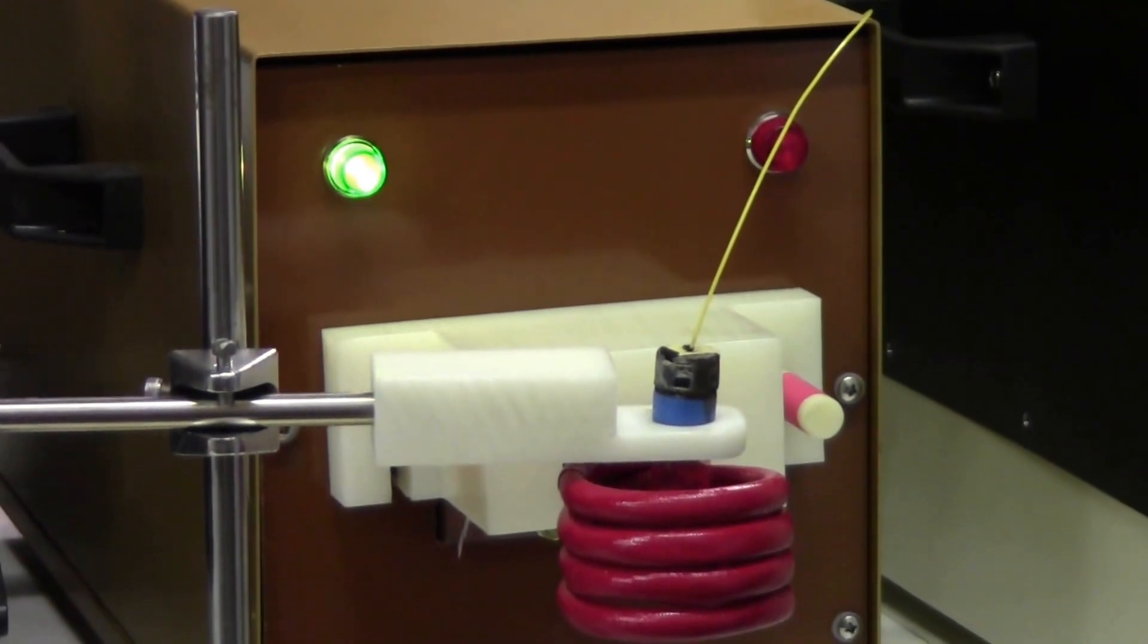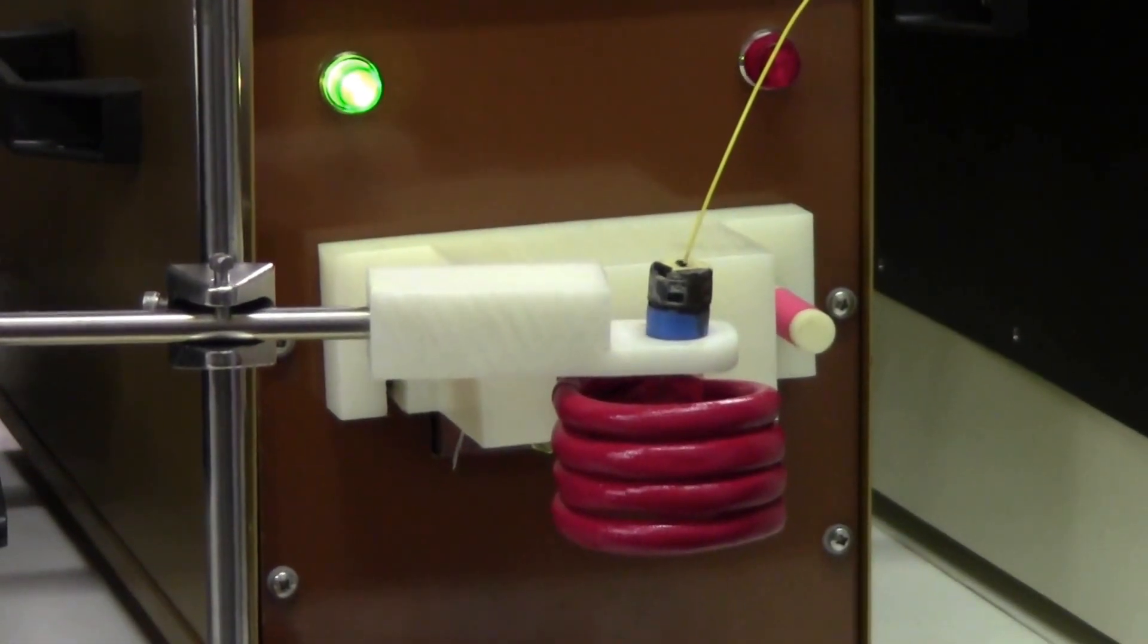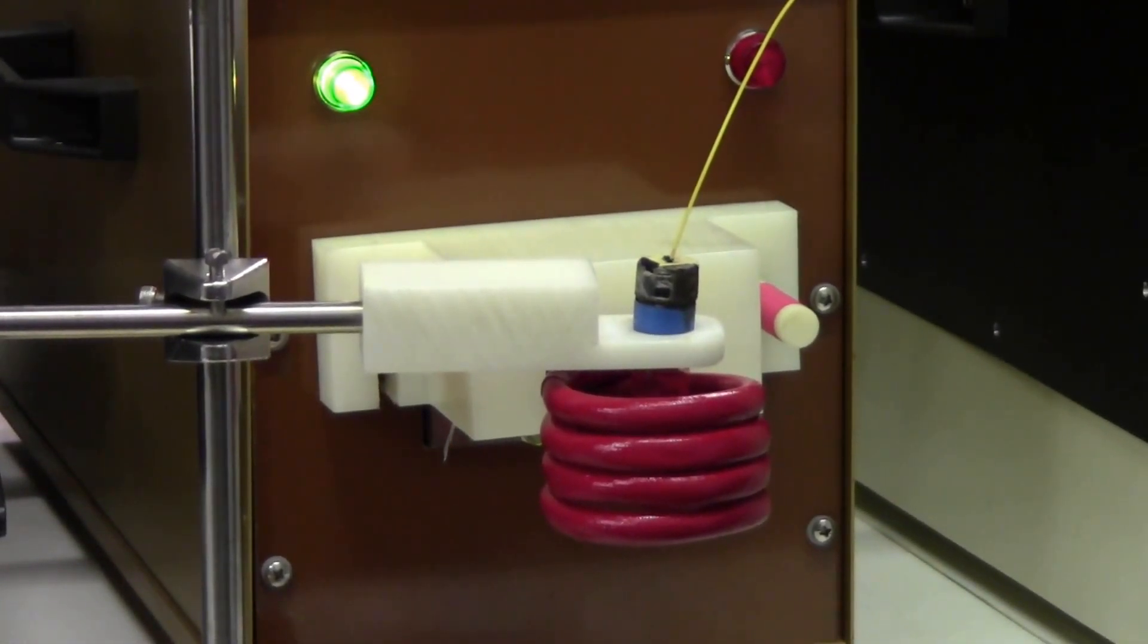So I'll press start heat, and now we're heating. I'll press stop heat. Press it again. We didn't have the power set quite high enough. Now we're at full power.